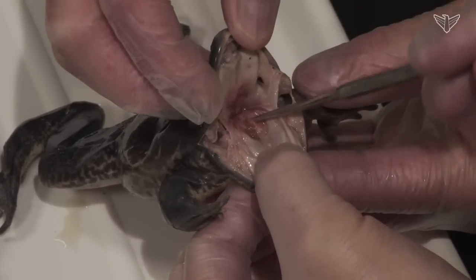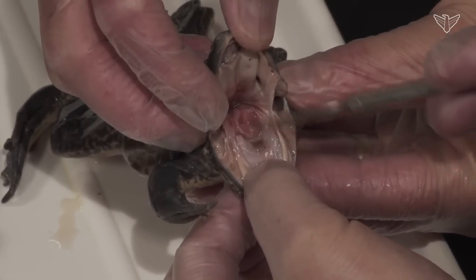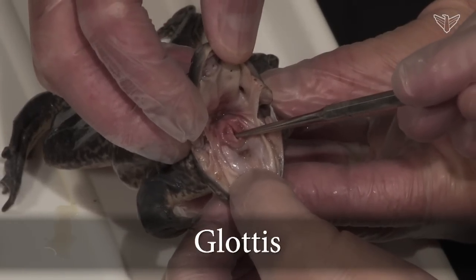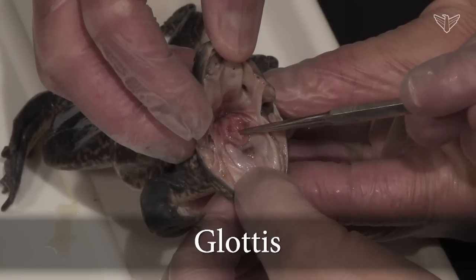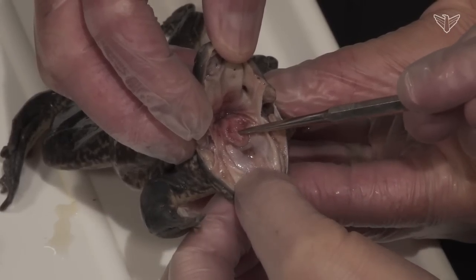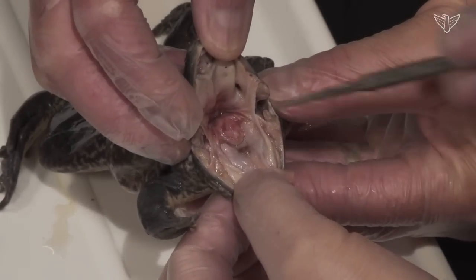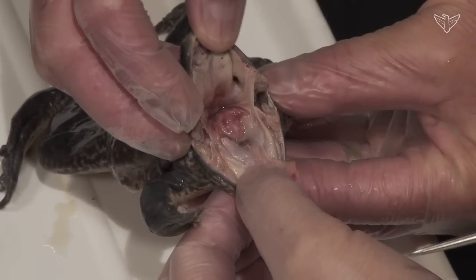Another nice structure to look at here is the glottis — the opening to the trachea that goes to the lungs. We have this too; we call it the epiglottis. When you're swallowing food, that closes so food doesn't go into your respiratory trachea and clog your lungs.